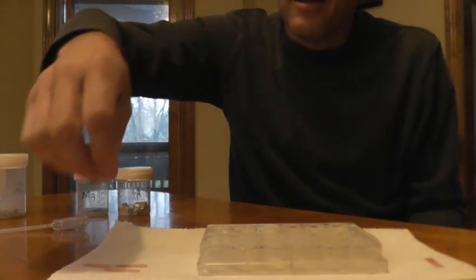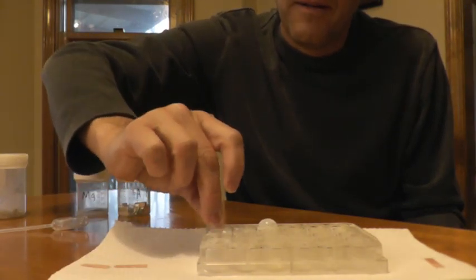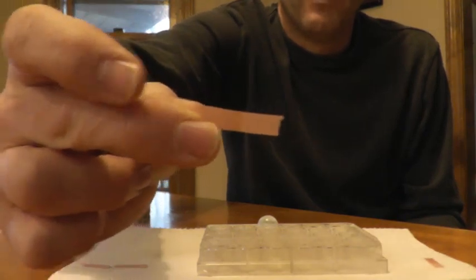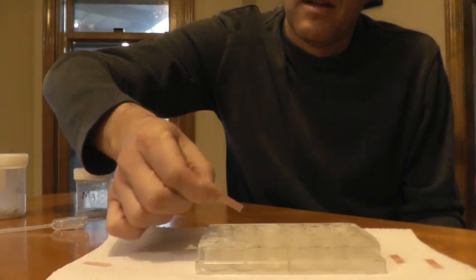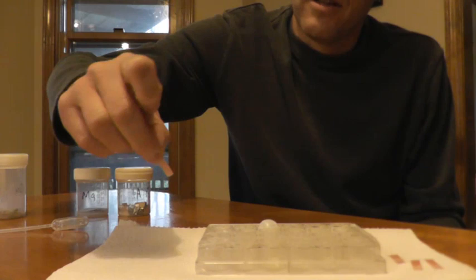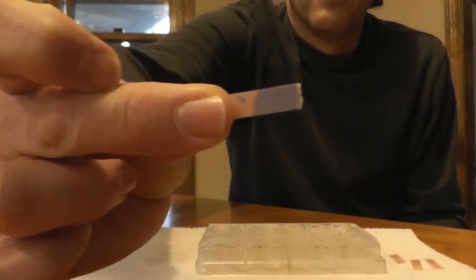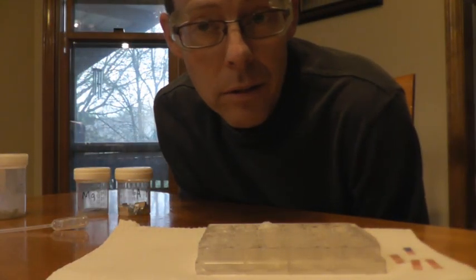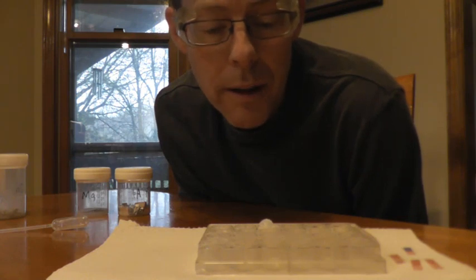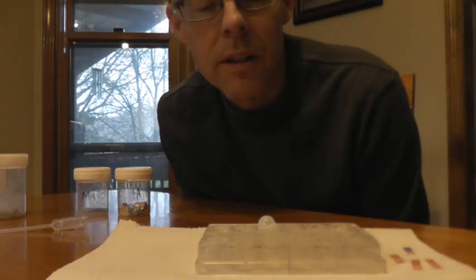So with that, I'm going to stick this piece of litmus back in where we put the aluminum. And it's remaining pink. And I'm going to stick this one in where we put the magnesium, and it is remaining pink. And I'll stick this one in the calcium. Let's break that bubble up. And it turned blue. So it looks like as we go down a group, elements might become more reactive. Also, if you put your hand next to this, we see it gives off heat.